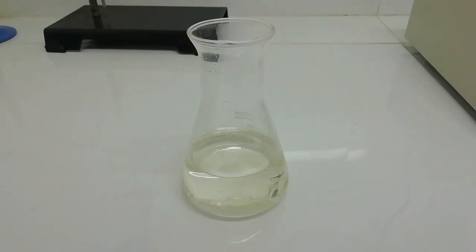Right now this is the solution of sodium bisulfite. If you want a solid product, we have to evaporate this water. But remember, if you do so, you need to distill this water under vacuum. Otherwise the heat will decompose the product.